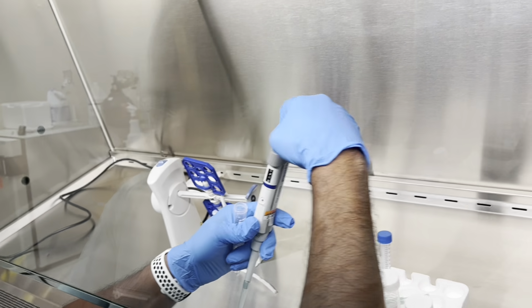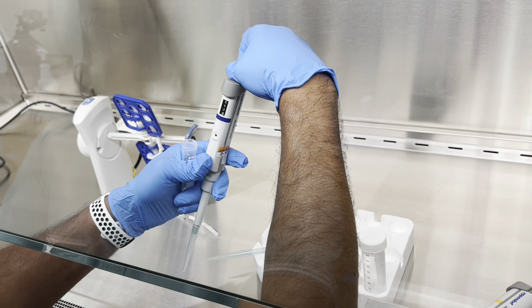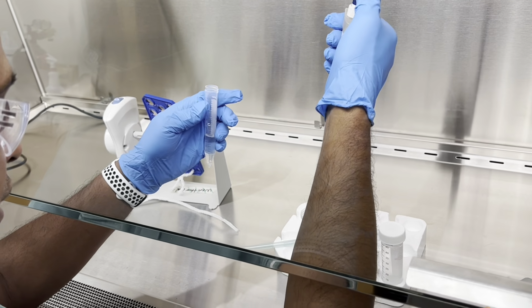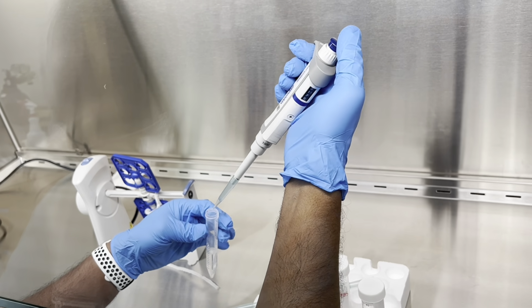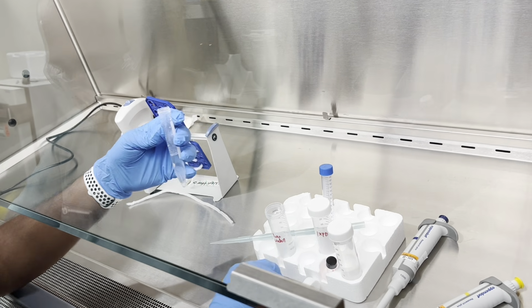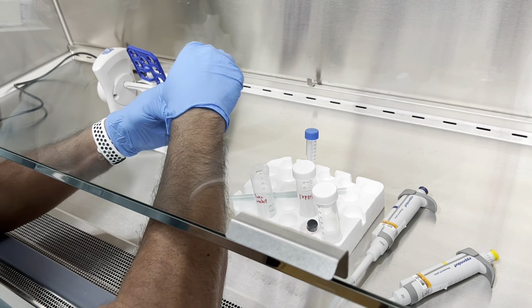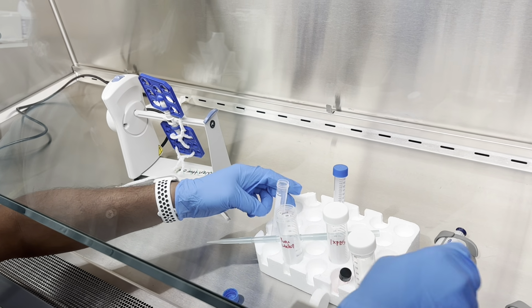Oh, such precision here. You can take 175.76, it's okay. A little extra, like 0.5 extra. Okay, so the water is done. And what we can do is just mix it. Was this your new calculated amount of water? Yes, the reduced amount.